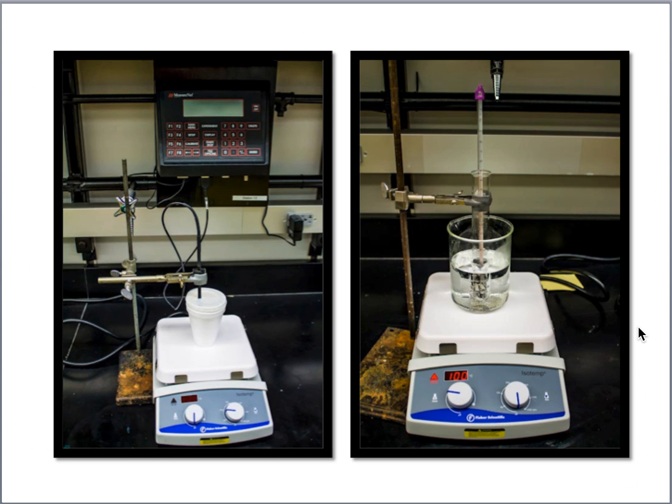Let's look at the actual experimental setup that we'll be using. Okay, now you'll notice our calorimeters are very, very fancy, very, very high-tech styrofoam coffee cups. They actually work quite well for our purposes. Okay? So just make sure that your cups don't have holes or tears in them or anything like that. And you will have 2 cups, one nested inside the other with a lid. That's going to serve as our calorimeter.